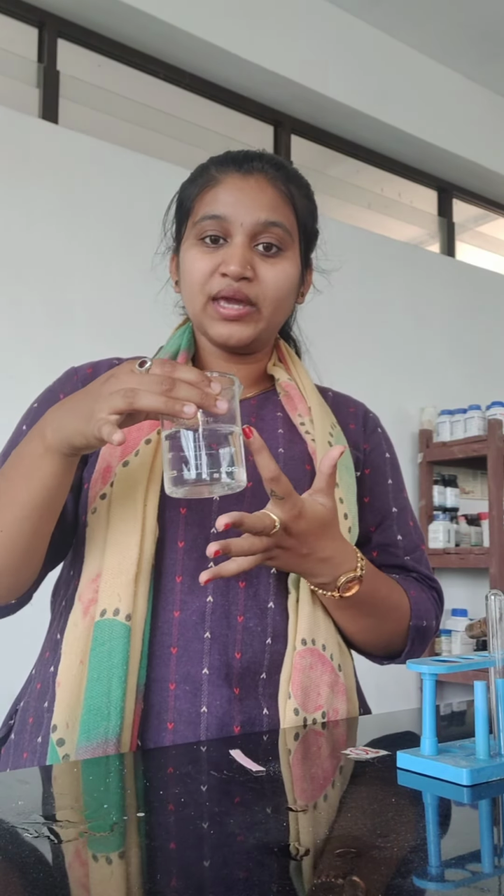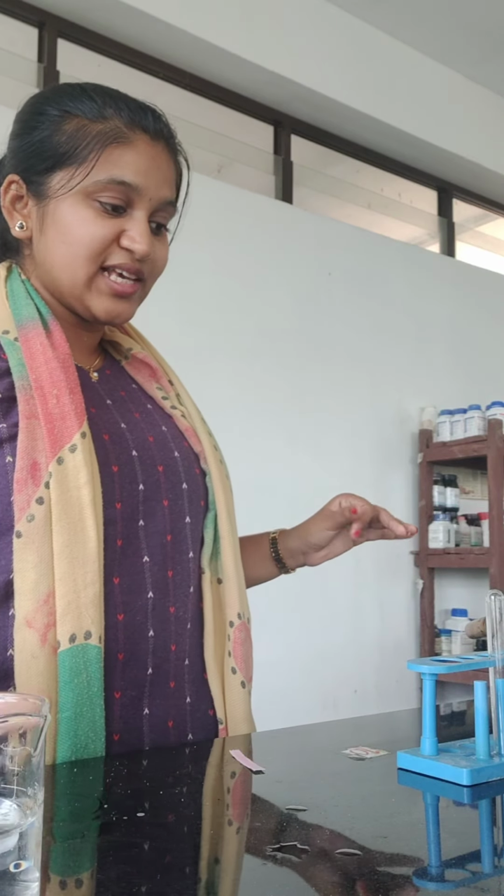We will perform an experiment and see whether the temperature, that is heat is liberated. If the heat is liberated, then the temperature of the surrounding, it may be a beaker or conical flask, anything it may be, it changes the temperature, that is heat we can sense on the outer surface of the beaker. So we will perform an experiment.